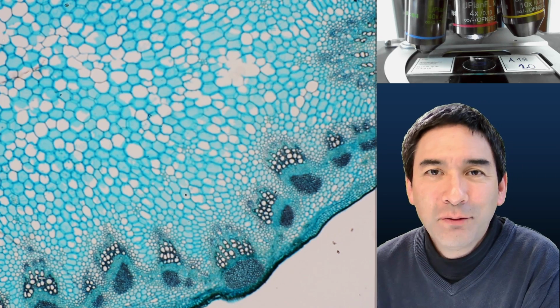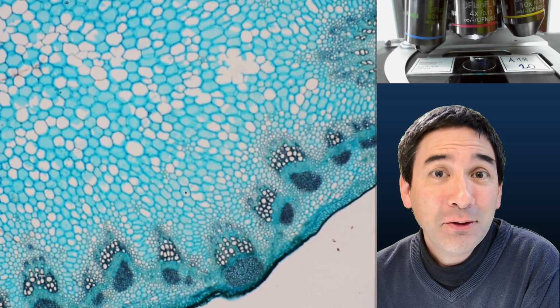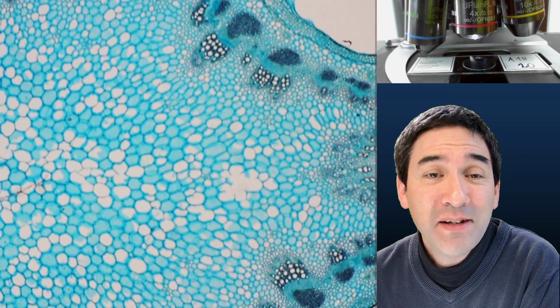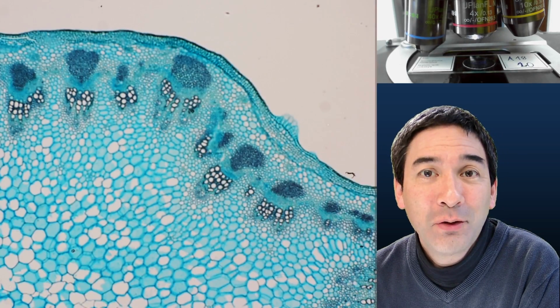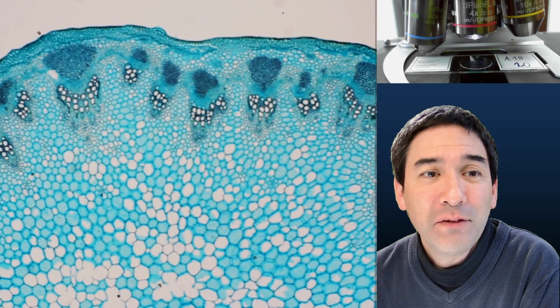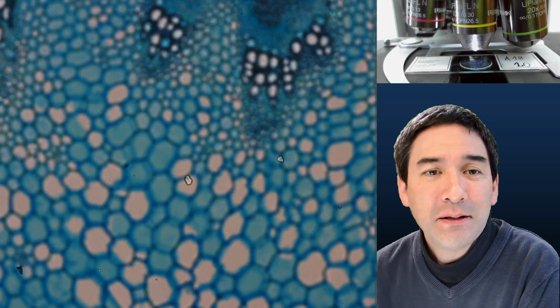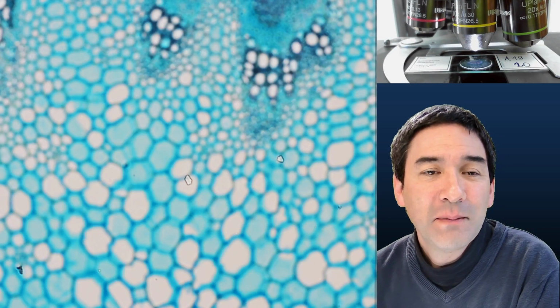So this sunflower does show a very nice pattern. The cells are all very nicely visible. It's a typical pattern of a so-called dicot plant. I just want to explain very briefly what you're able to see here. Let's go up with the magnification a little bit. Yep, we have to refocus again. And what we see here are the so-called vascular bundles.